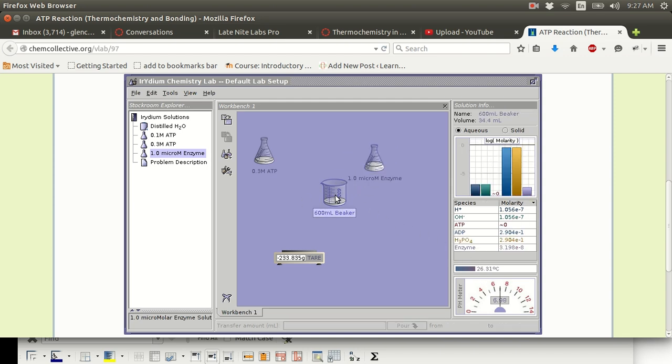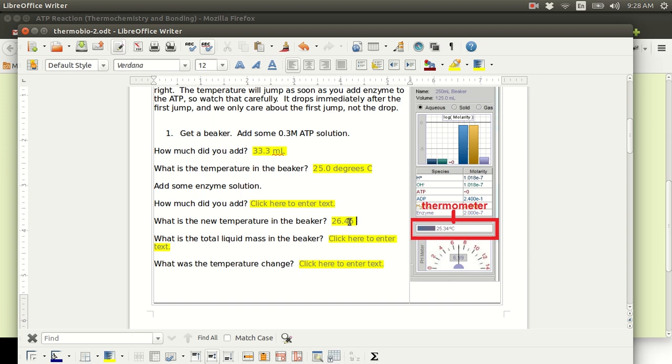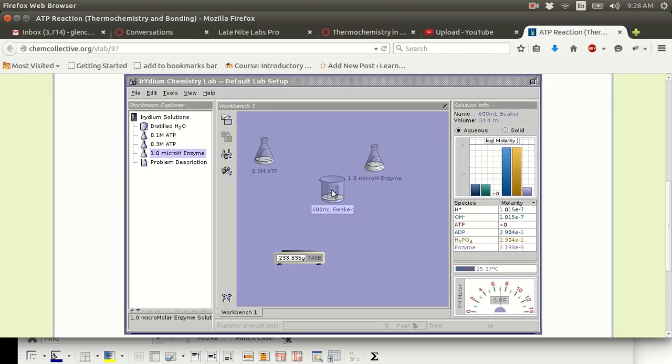It was 26.45 degrees Celsius, and it is dropping really fast. It's dropping because this beaker is cooling off because the room was 25 degrees Celsius. So that's a little difficult to see the new temperature in the beaker, 26.45 degrees Celsius. This question, what is the new temperature of the beaker? I'm looking for the highest temperature. So you would have to look at that really, really fast. I added 1.1 milliliters of enzyme solution. Now there's a way around that.